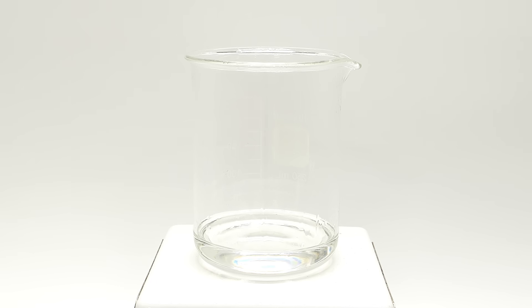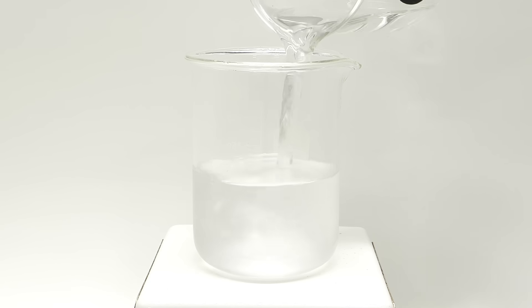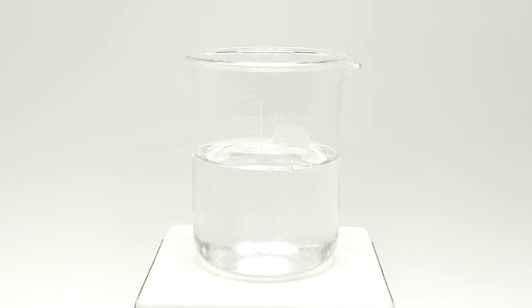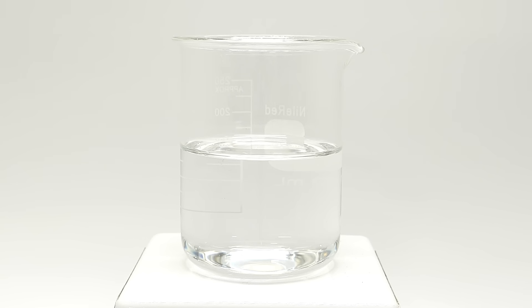What I had now was a concentrated solution of mercury nitrate, and I diluted it with a bunch of cold water. Now, I can add the final ingredient, which is a solution of potassium iodide.